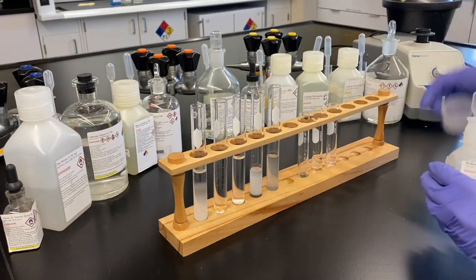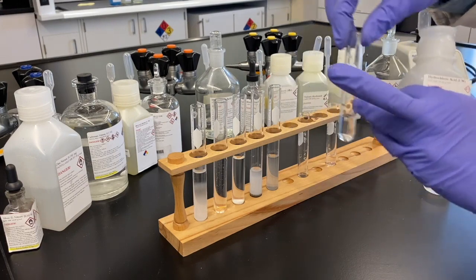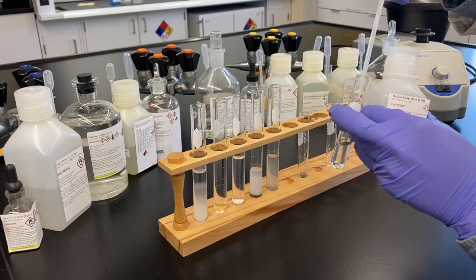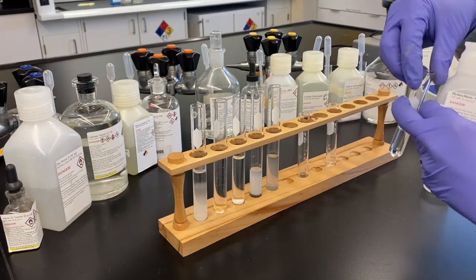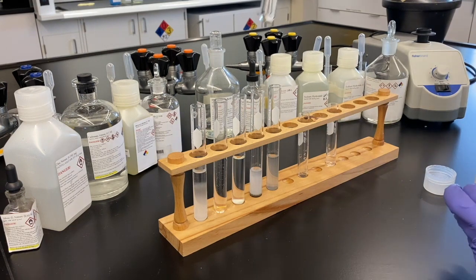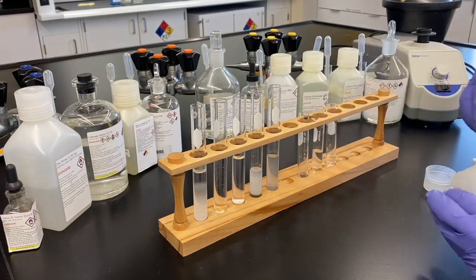Okay, so this should be hydrochloric acid, right? There's our supernate. Yes. Right, it could have silver. 1 molar. Great, we're going to test it with hydrochloric acid. I'm not seeing this precipitate. Right. If silver was there, it would make silver chloride, a white precipitate. It's not there. So you're saying we don't have silver. That seems to be the case.